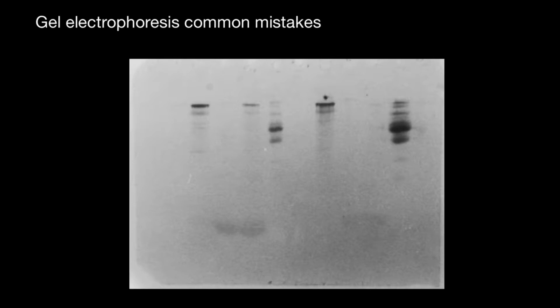The acidified alcohol in the stain solution and the destain solutions is essential. It precipitates proteins, preventing them from diffusing out of the acrylamide matrix. So do not forget to follow the protocol, and such mistakes might lead to what you see in this picture in this gel. So this is all for today.